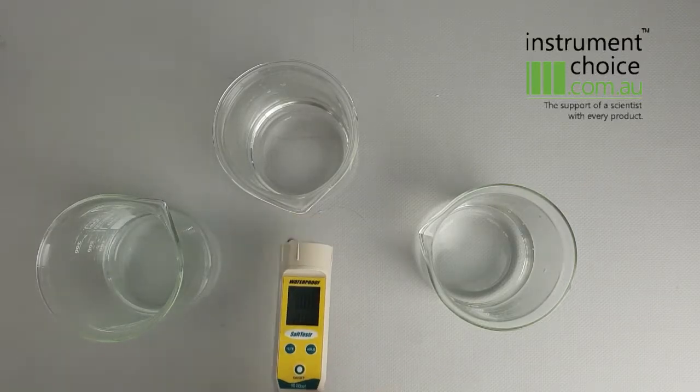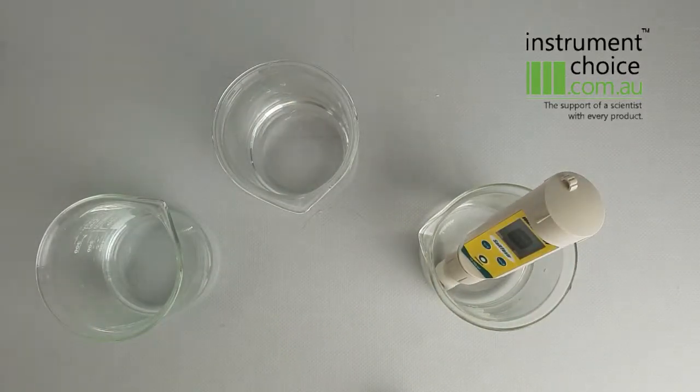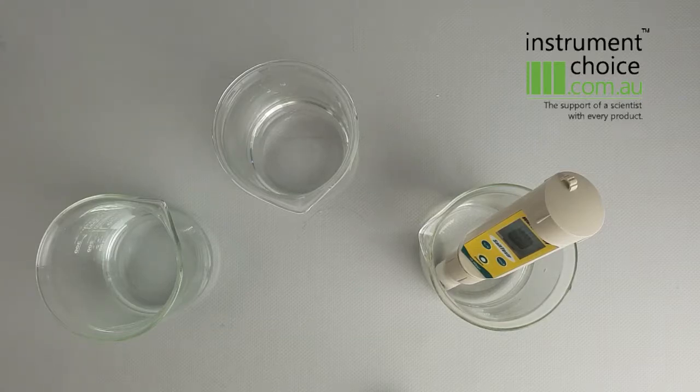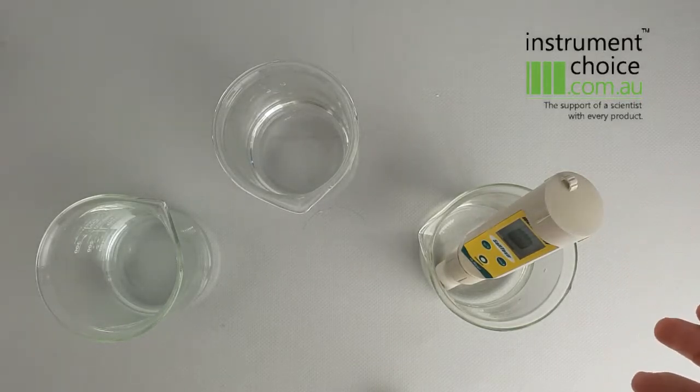Basically what you want to do is remove the cap, put it into your isopropyl alcohol just to allow the sensor tip to be covered. Leave it in there for approximately three to five minutes, and once that's done give it a good shake off. I'm obviously not going to leave it in there for three to five minutes just for the video purpose, but make sure you do do that.